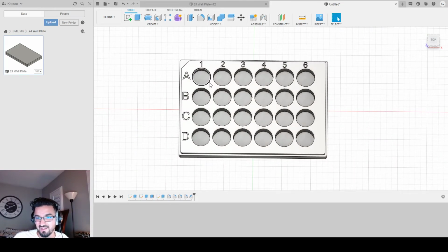Another thing you could do that I kind of like doing is selecting the outer circumference of the circles, right? So you don't have to do this. I like doing this because it's a drop off here right now, right? Oops, that's the circle. We got to make sure we select circumference only.